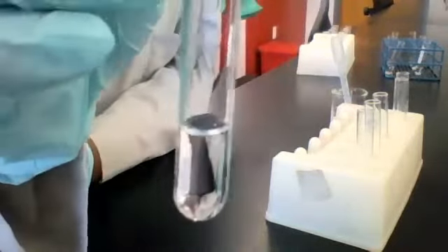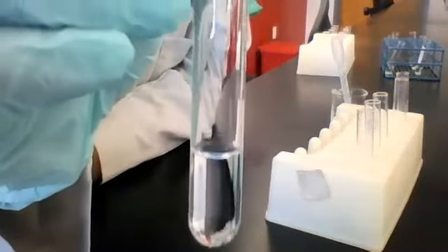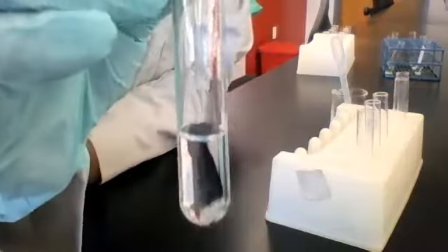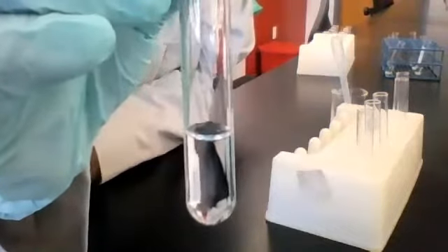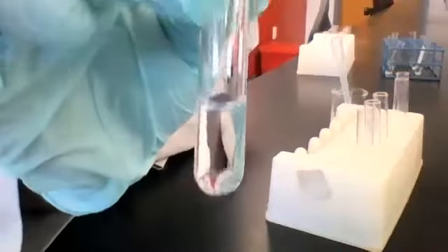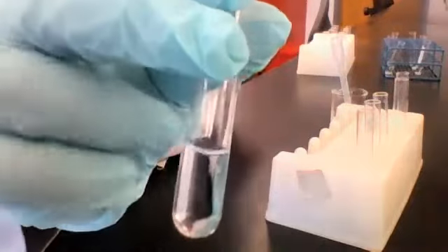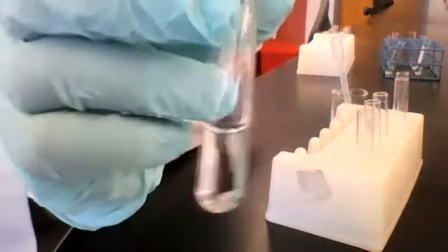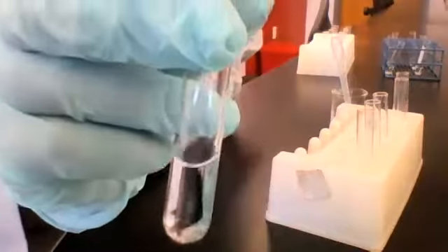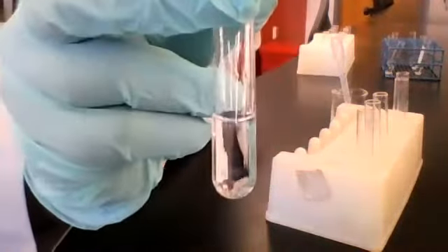Okay, here's the resulting mixture. But now you can be sure there's no precipitate here. This is just a solution. The tube hasn't gotten warm or cold, so there's been no heat change. I don't smell anything coming from the tube. There's no bubbling, no gas forming, no change of color, no formation of precipitate. So no visible change that we can see between MgSO4 and HCl.